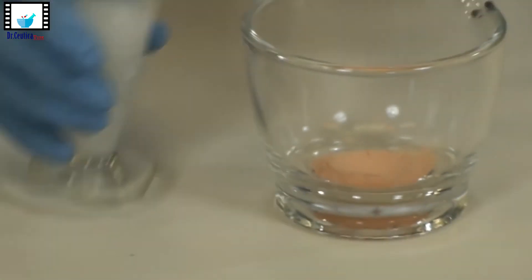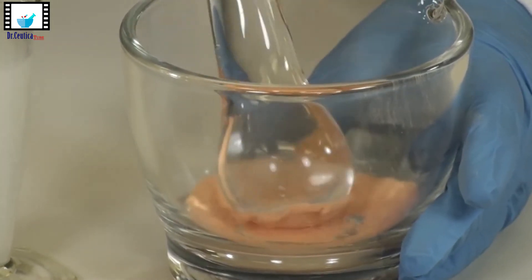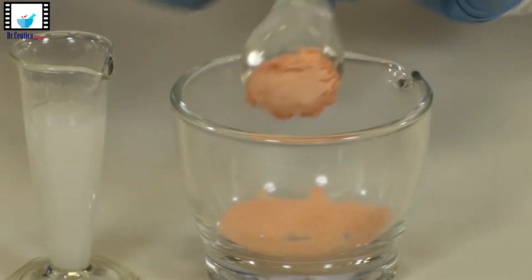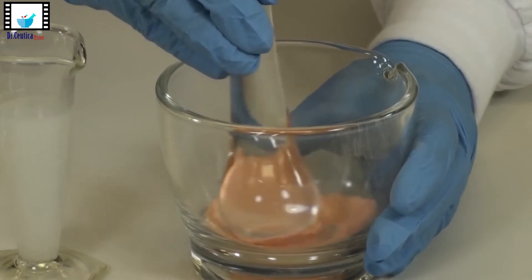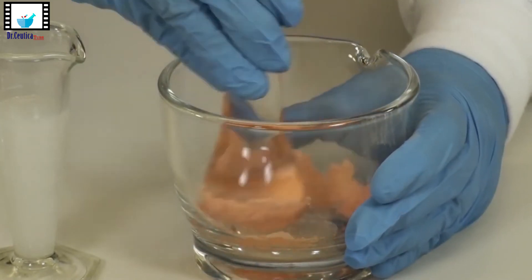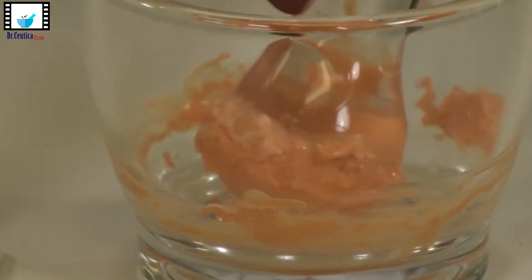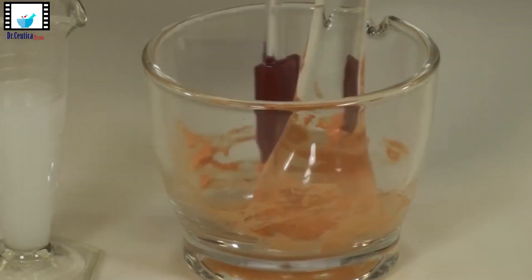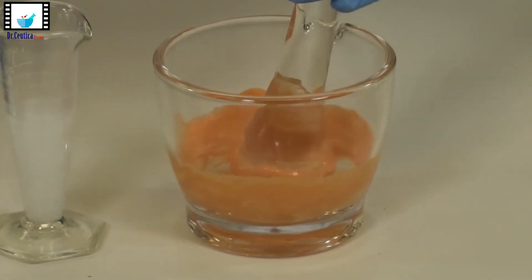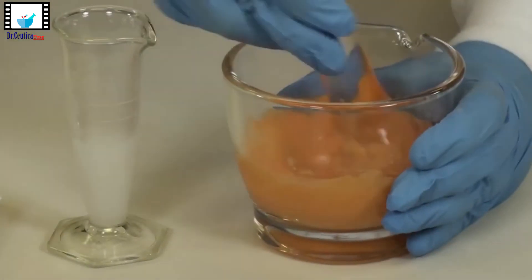For adding the liquid suspending agent, put the pestle in the middle of the mortar and press gently to create a hole. Add some of the suspending agent there and start triturating gently. If it sticks to the pestle, don't panic — continue adding the suspending agent and triturating gently. Don't press too hard or you will get clumps. Use the rubber spatula to scrape the drug from the pestle every once in a while, and also from the sides of the mortar.